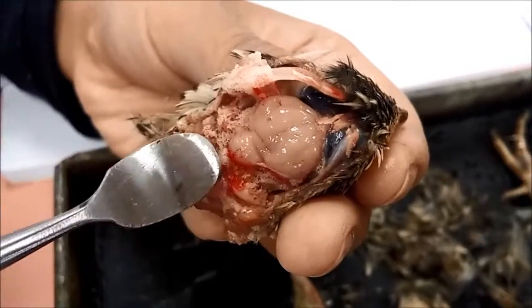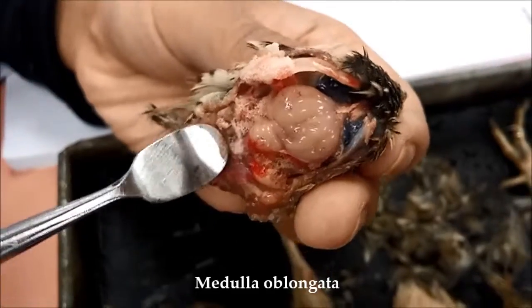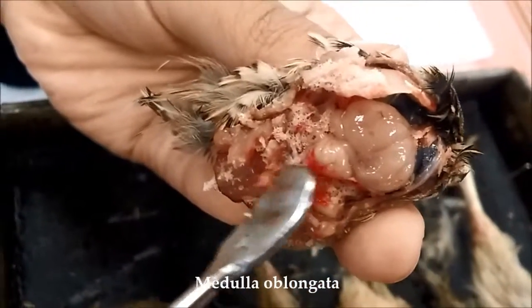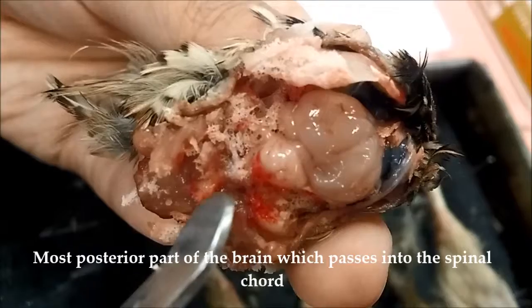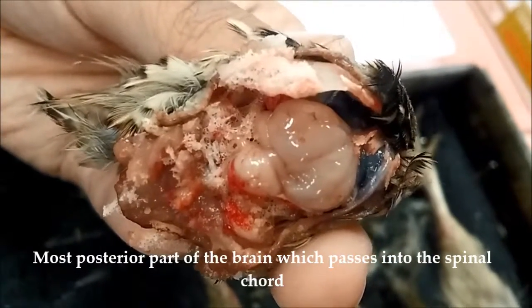And lastly, the medulla oblongata. Basically the medulla oblongata is here. It is the most posterior part of the brain, which passes into the spinal cord that leads through the foramen magnum.